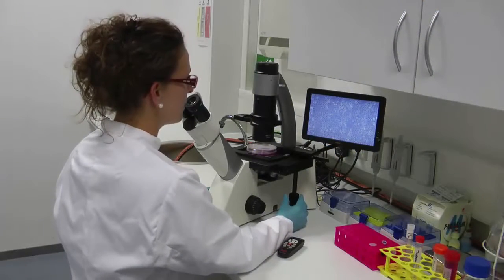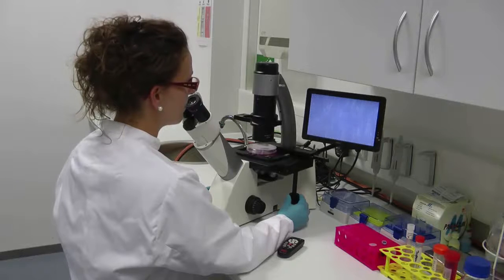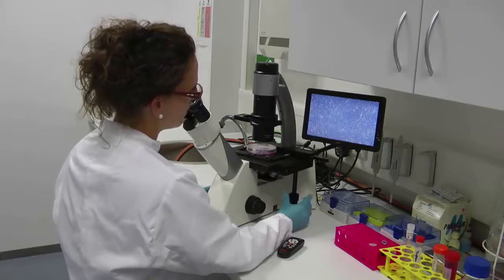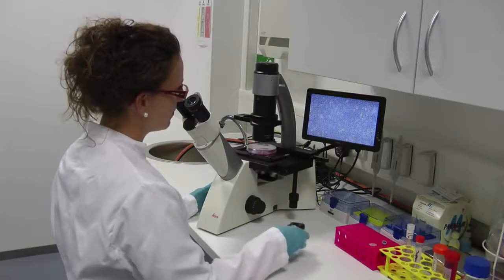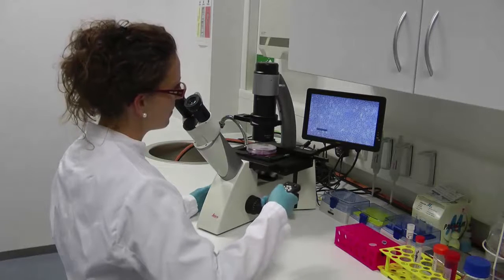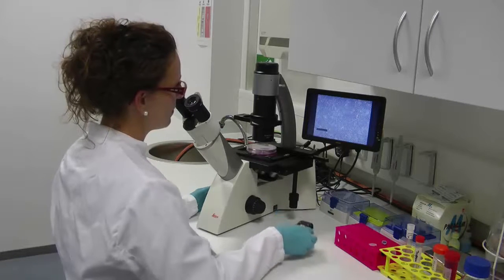Documentation of the cell status is very important to ensure uniform results across experiments. The Leica DMI1 can be equipped with a camera and screen which allows easy imaging and saving via remote control.